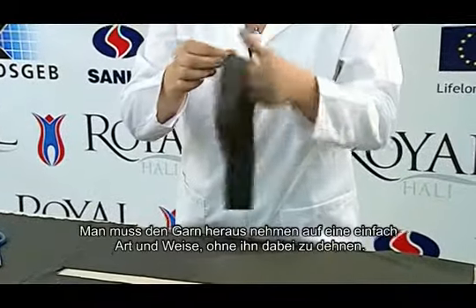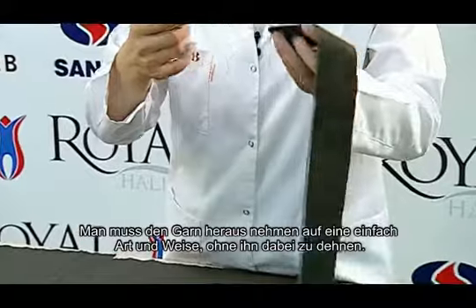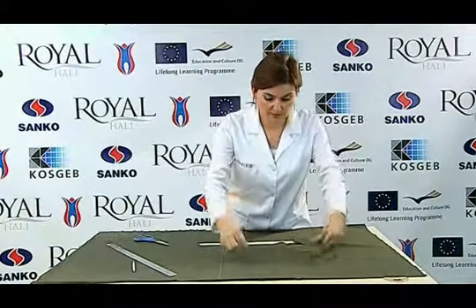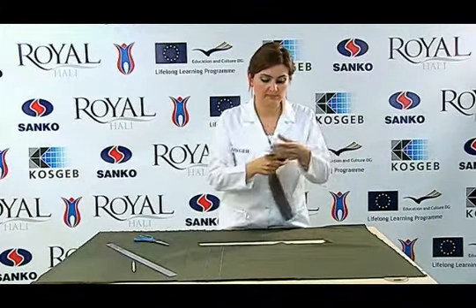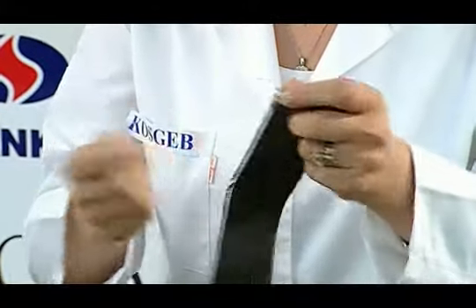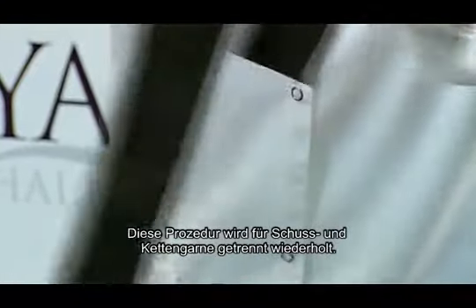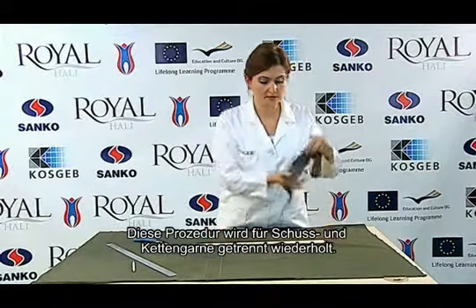We should take the yarn out in a free manner, that is, without stretching it. This process is repeated for the weft and warp yarns separately.